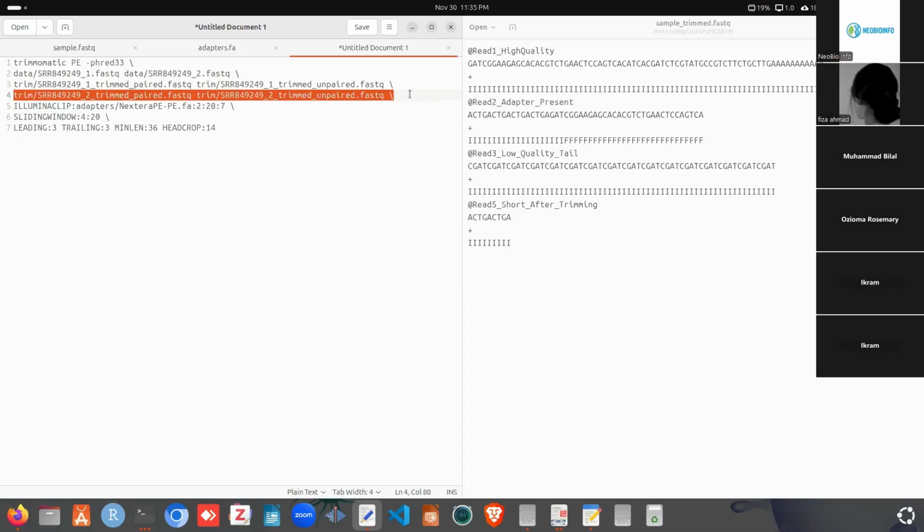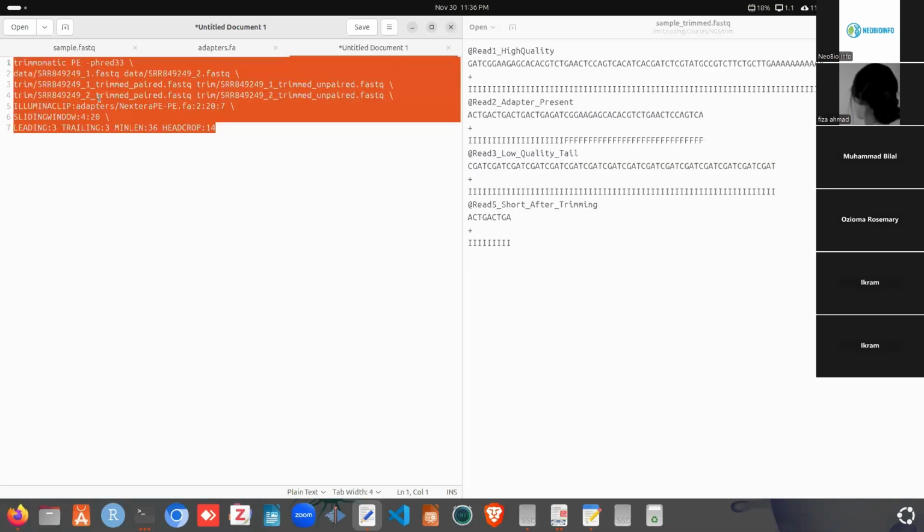Trimmomatic processes each read file, that is R1 and R2, separately, and after processing, it dropped some reads from R1 and dropped some reads from R2. We said that at first every read in R1 has its mate, the reverse mate, in R2. So after trimming, if an R1 read has lost its mate because that was removed in R2, then that R1 read goes to the unpaired file, and if it finds the mate in R2 after trimming, then it will be written in the paired file. So now we can copy the command in here.